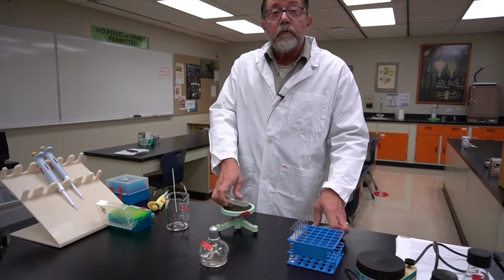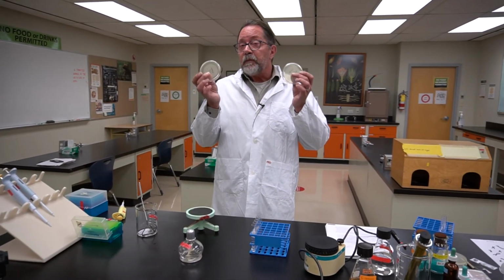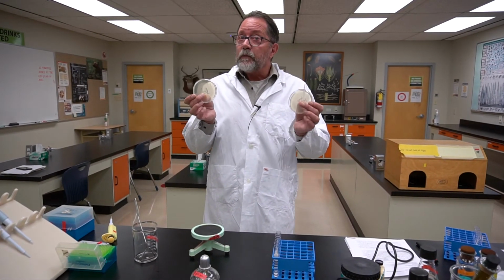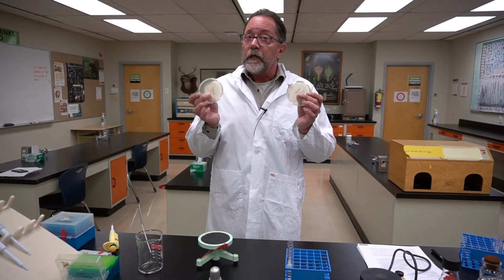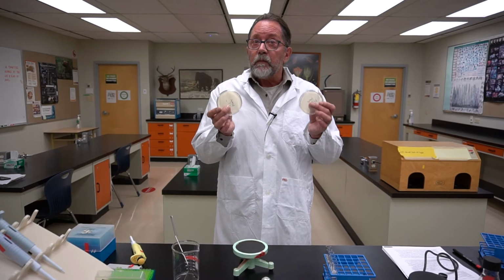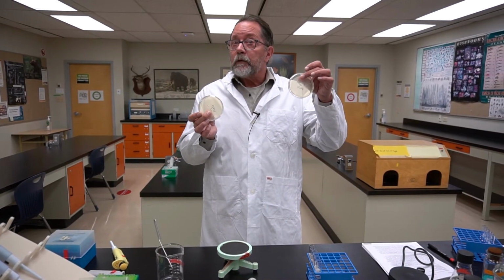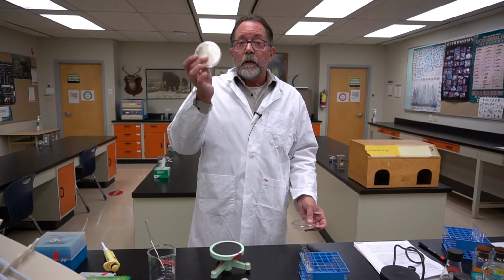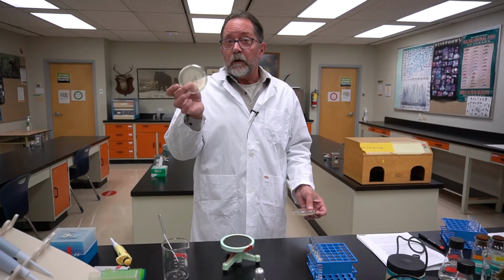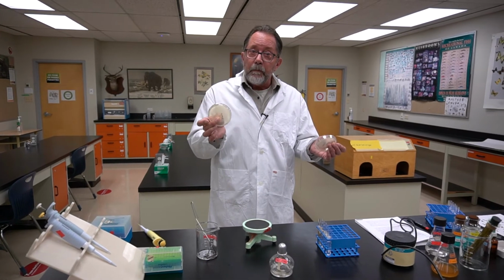Now, in truth, you would be making a stack of 5 plates each of the His plus and the His minus. And you'd use the same tube and the same dilution for each of those plates. And by doing that, theoretically, you've put the same number of cells on the His plus, about 100 to 1,000. And here, you would put hundreds of thousands of cells, if not millions of cells, on each of the plate, and they'd all have the same number of cells on them.